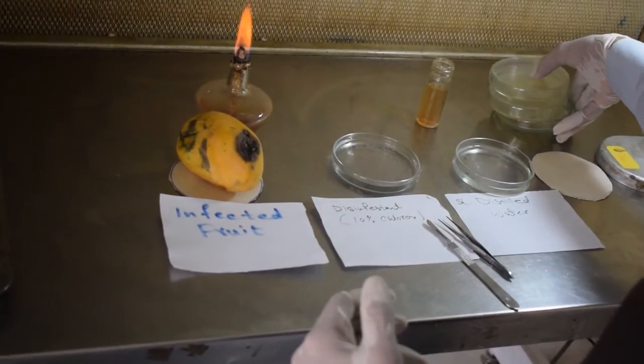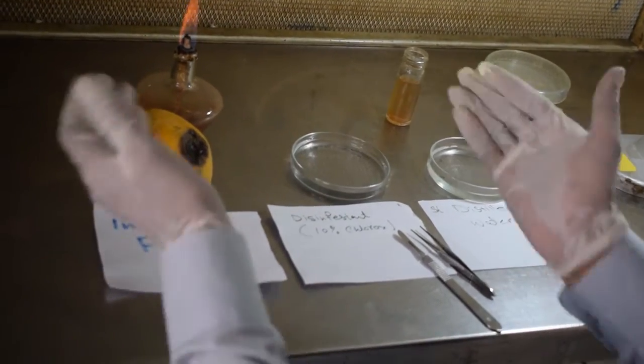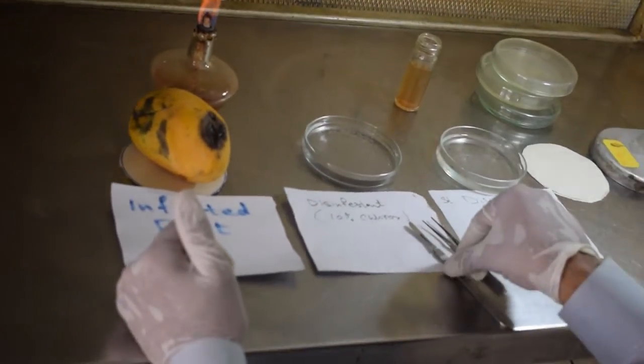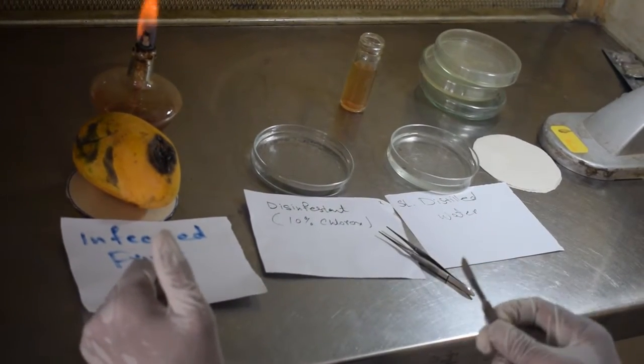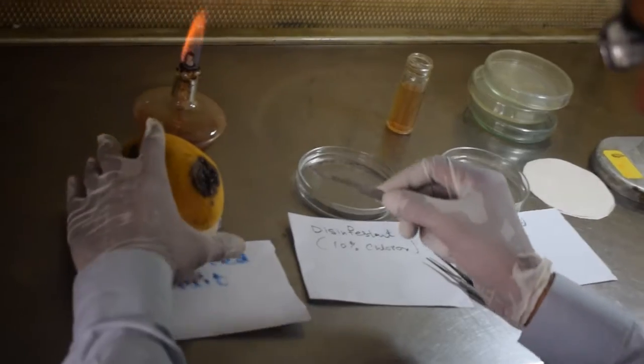So for today, the isolation of the fungi from the infected part, let's start from the beginning - how to cut the portion and how to place it. Bismillahirrahmanirrahim.